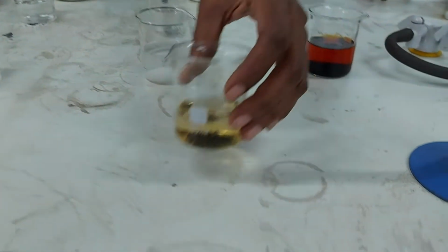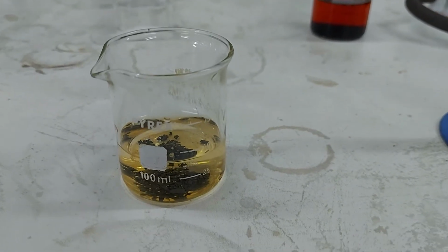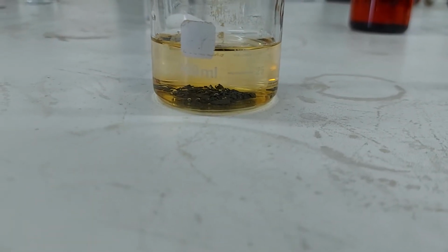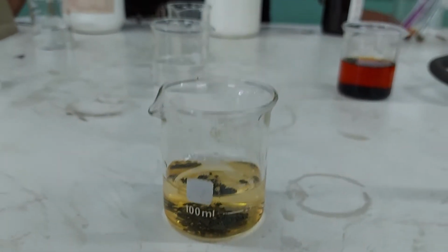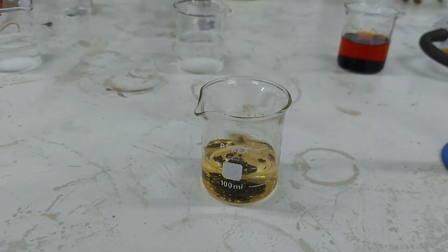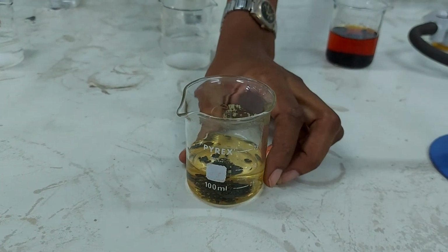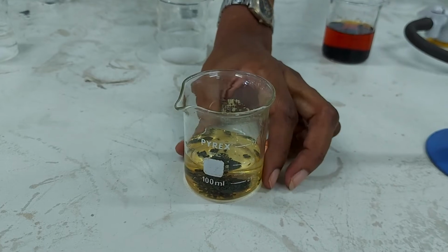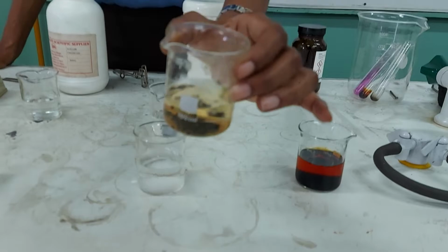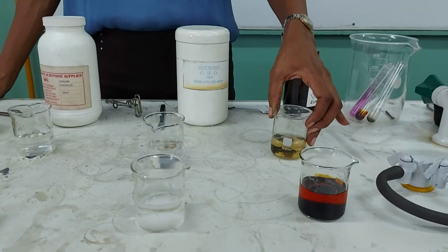This, on the other hand, is iodine. Now, our eyes are not deceiving us. We do have some brown occurring there, which means that there is some iodine scattered in between the water molecules, which means that it is very, very slightly soluble. Now, iodine, as you know, is a covalent substance and should not ideally dissolve in a polar solvent. But there may be a reason, so I want to hear from you what you would think would be the reason for us having some slight solubility of the iodine in the water.